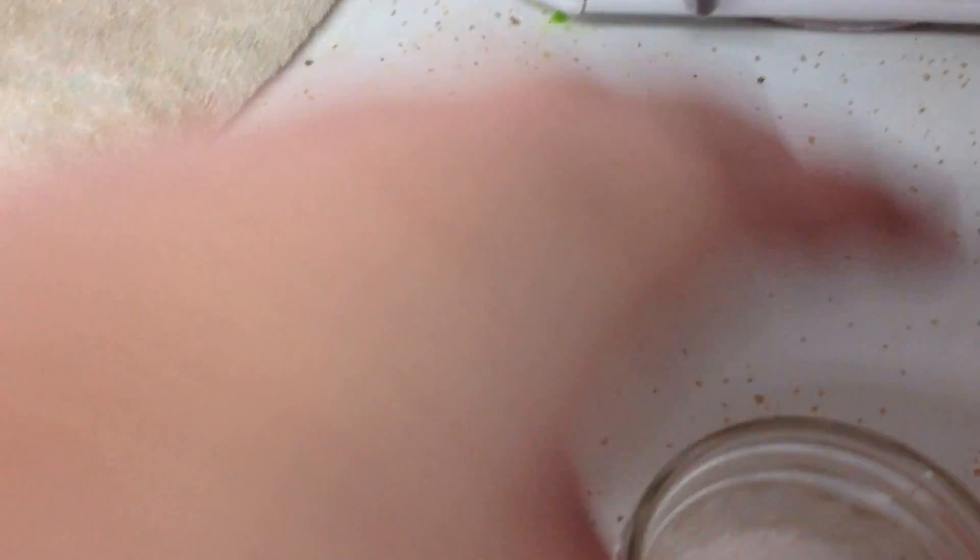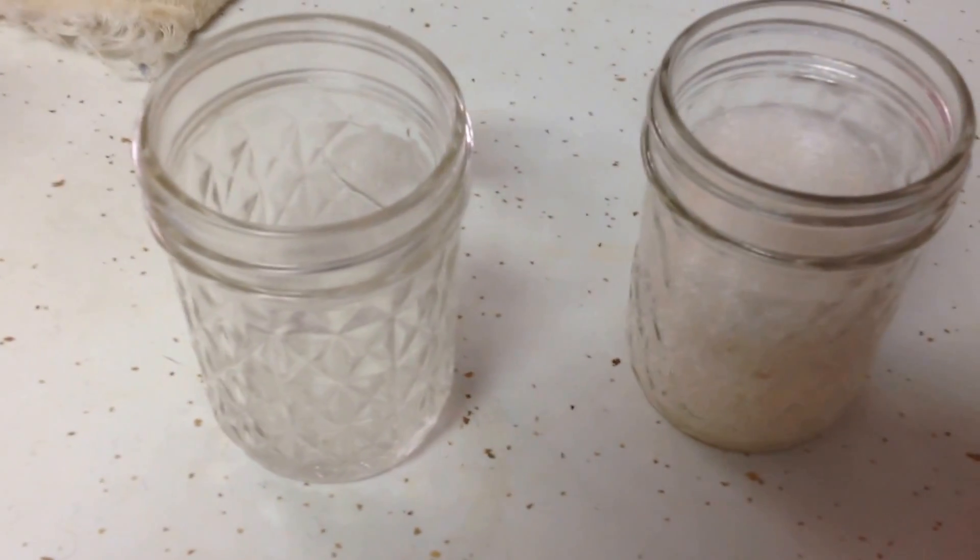In fact, there's very little peroxide left in this jar at all. So that's what happens when we add a catalyst to a chemical reaction.